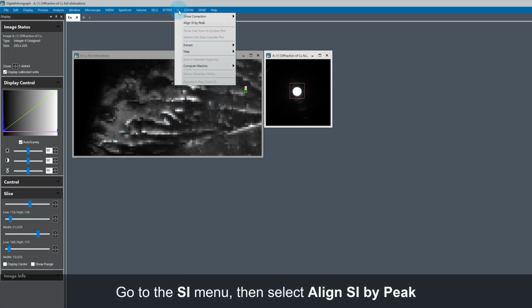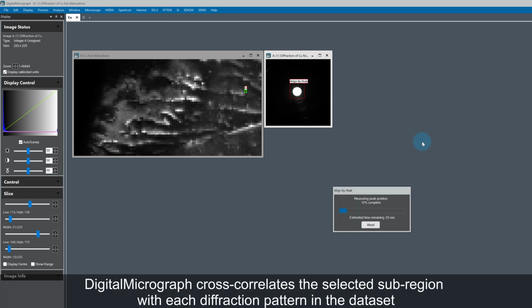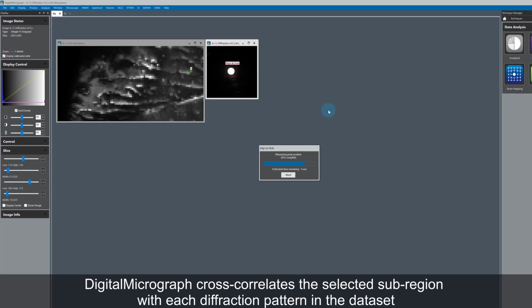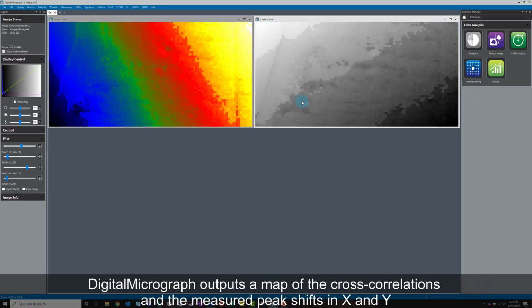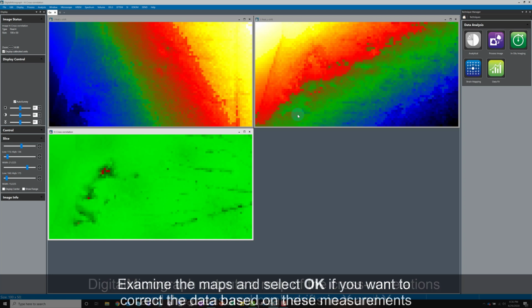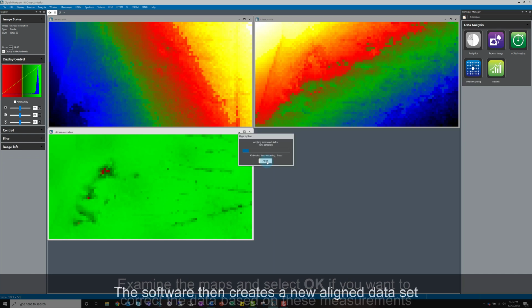Next, go to the SI menu and click on Align SI by Peak. The selected subregion is cross-correlated with each individual diffraction pattern in the dataset. The software outputs a map of the cross correlations and the measured peak shifts in X and Y. Examine these maps. If you are happy with the measurements, apply the correction and the software will create a new aligned dataset.